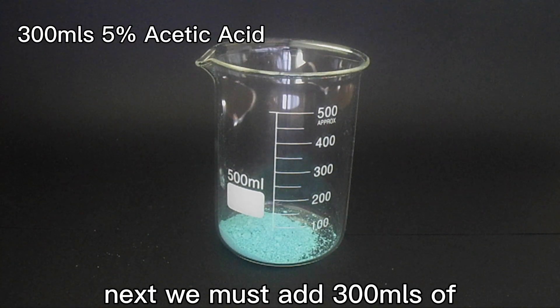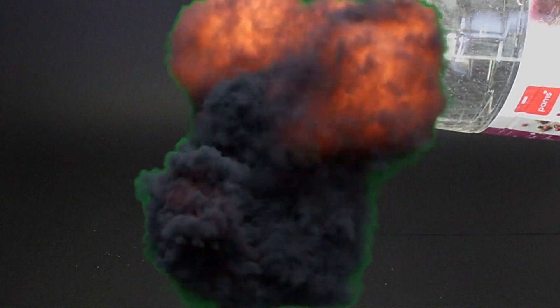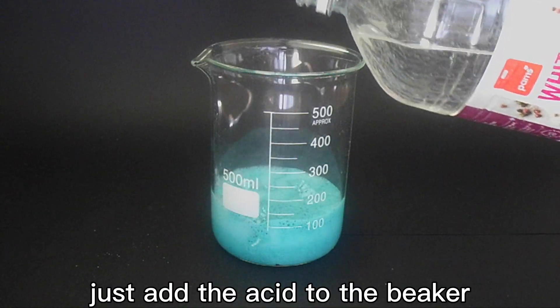Next, you must add 300 ml of 5% acetic acid into the—Whoa, that scared me. Just add the acid to the beaker.